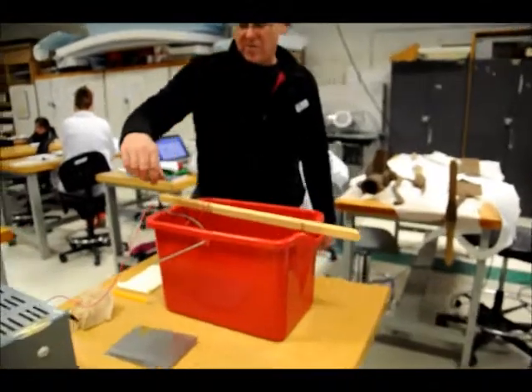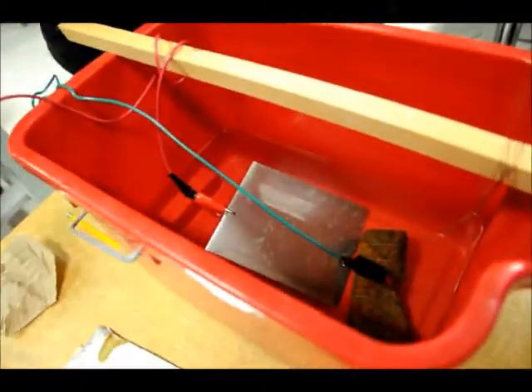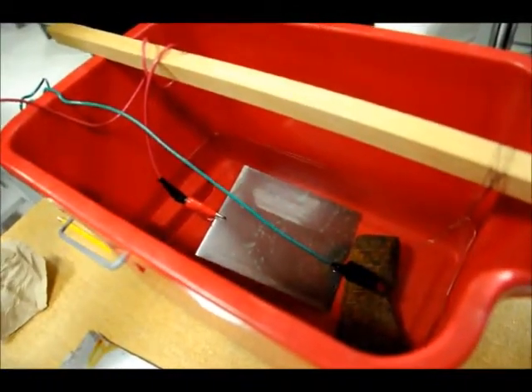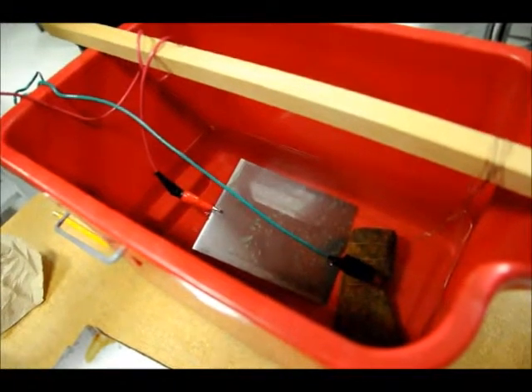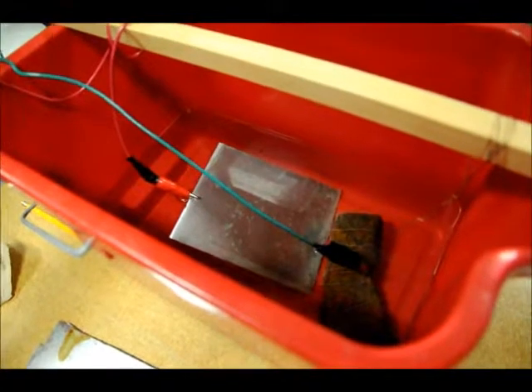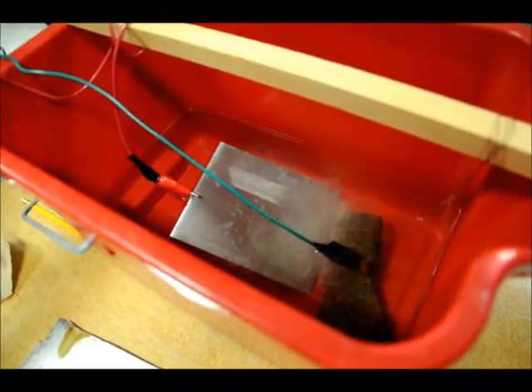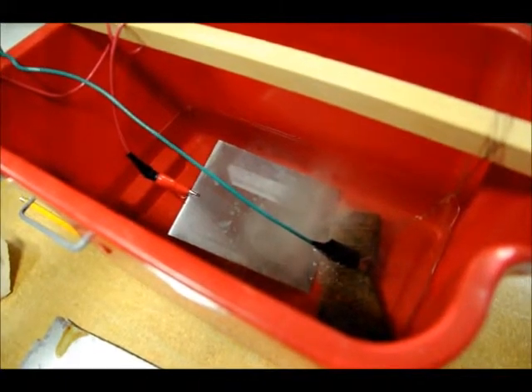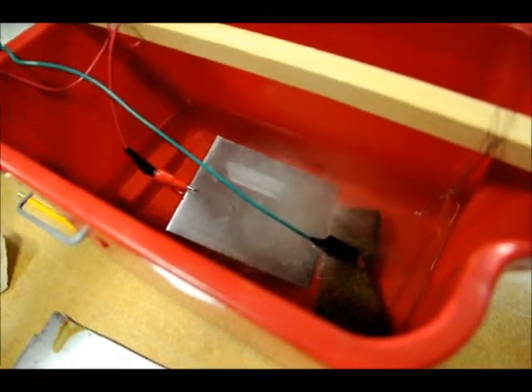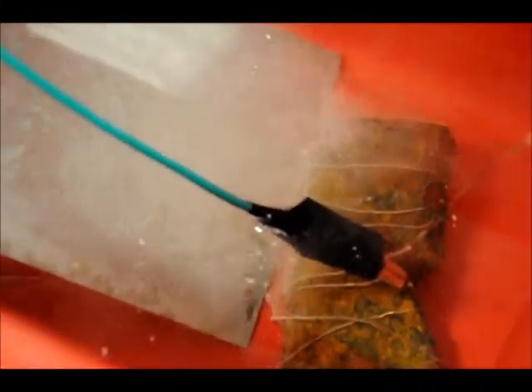Make contact, but I don't want to touch into the plate. I turn on the machine — power is on. I will now increase the amperage, and hopefully we'll start to see some bubbles forming. There they go. That's at about four amps, so I'll ramp it down just a bit. We're running at about three amps.